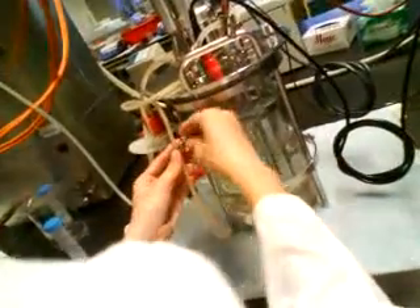And don't forget to clamp this stack. Just now the other group — the first person forgot to clamp this stack. So when he drew out the sample, it started leaking. That's why this part got wet.